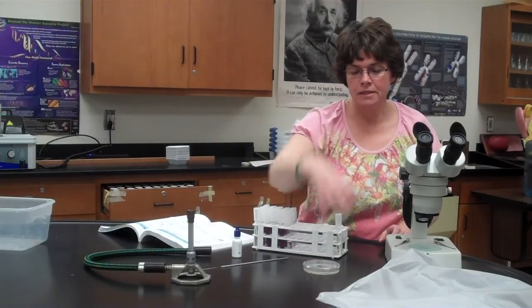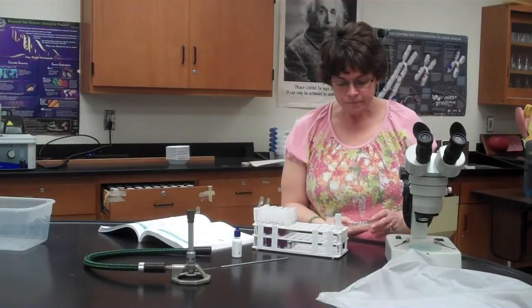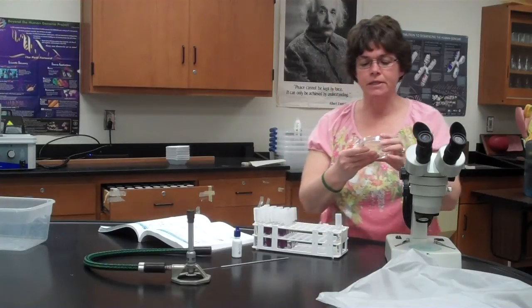So what we'll do is we'll take a look at the incubator on Monday or something, and if they're growing too fast, we'll take them out, okay? Because in the next class period, you're going to have to look at this plate and measure how far the colony grew. You're going to use the cultural characteristics that we learned in the very first lab, or I guess the second lab that we did in class.